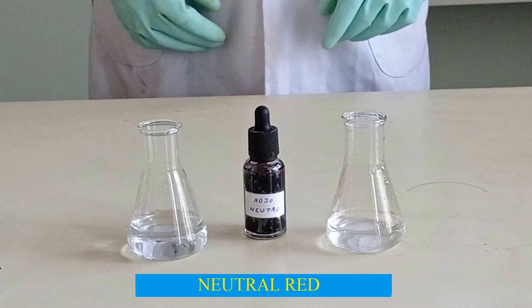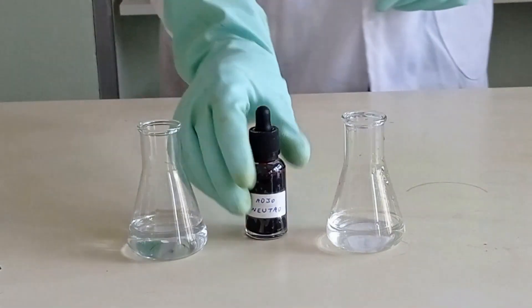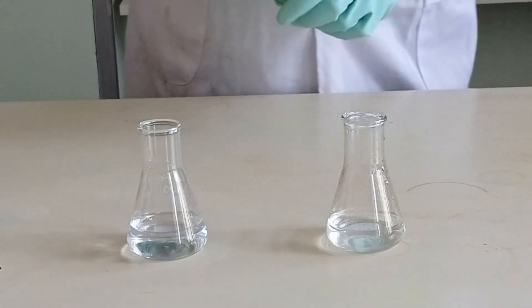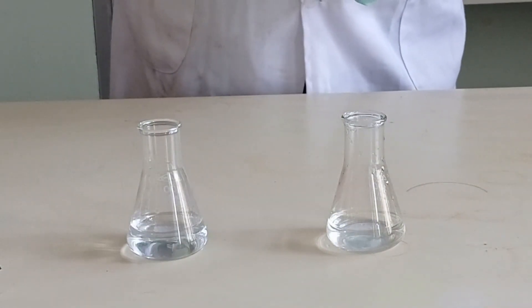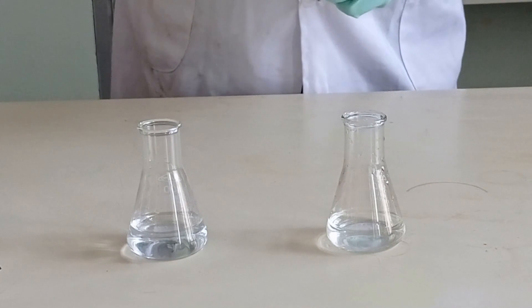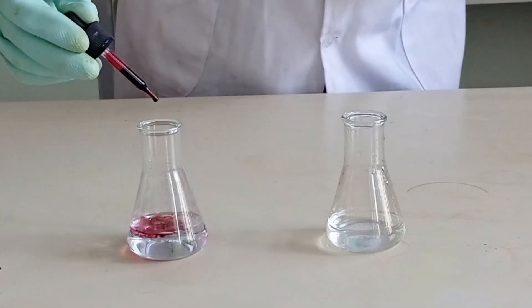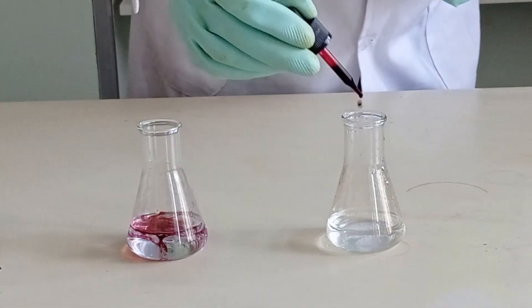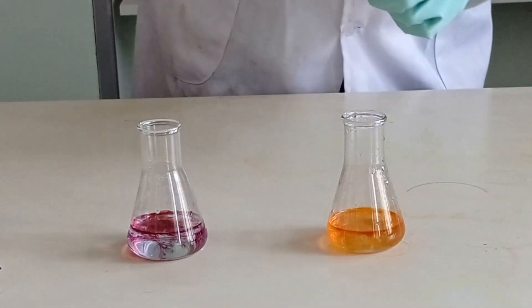This is neutral red. Neutral red in an acidic medium is red, and in a basic medium it is yellow.